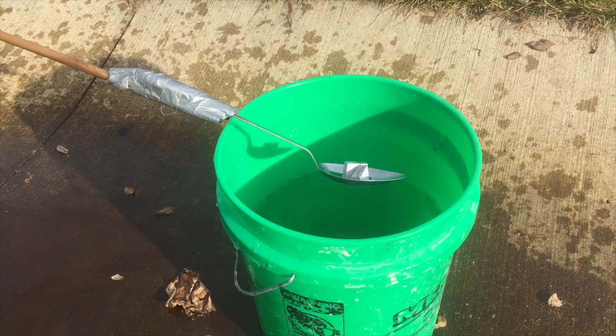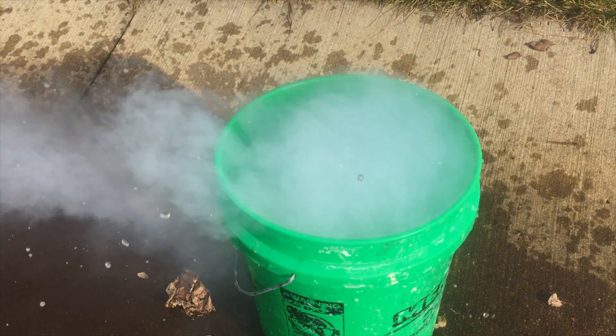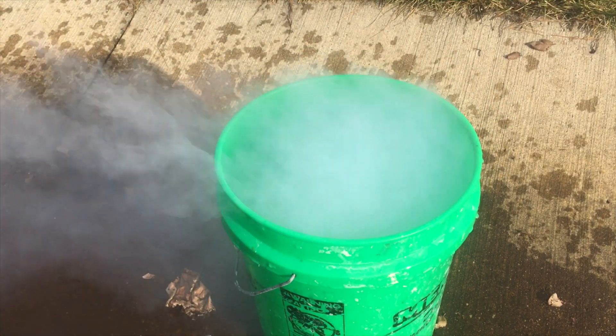Some things about sodium before we get started. Today, we are going to be going down to that bucket right there, which is filled with water. What most people know about pure sodium is that it reacts with a lot of things, but water creates a very exciting explosion when you put a lot of sodium in there. So that's what we're doing today.